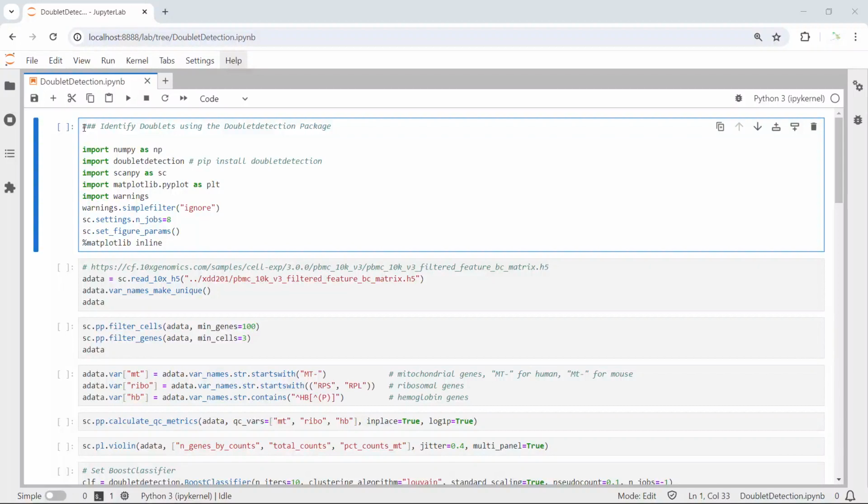Today, I'm going to show you how to use the doublet detection package to identify doublets. Identifying doublets is an important step to perform quality control in our analysis. If you don't remove doublets in your single-cell RNA sequencing data, it will generate separate cell clusters in your UMAP, which will affect your downstream analysis.